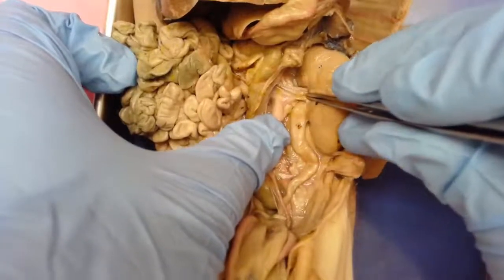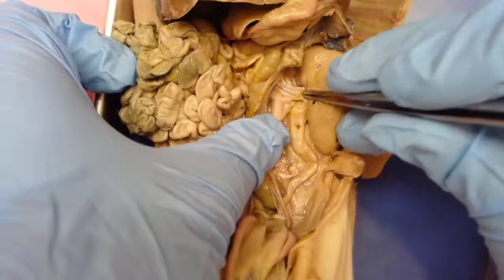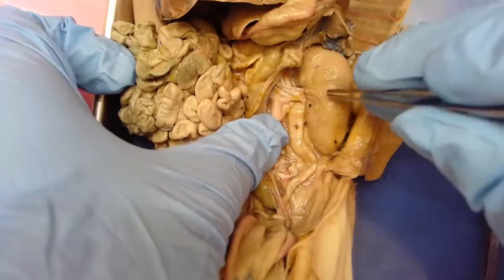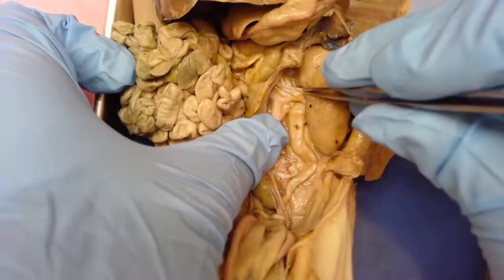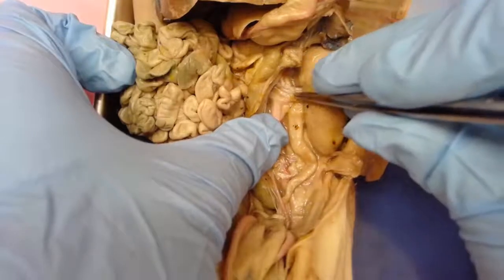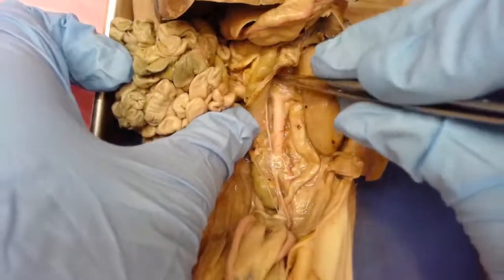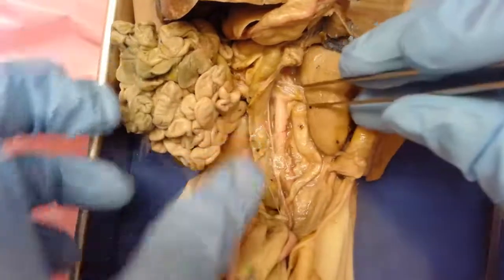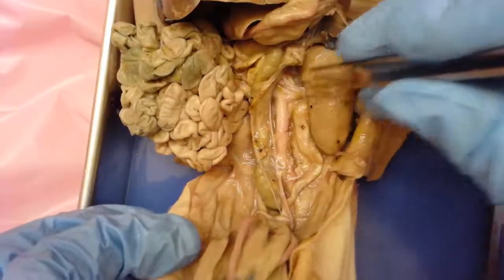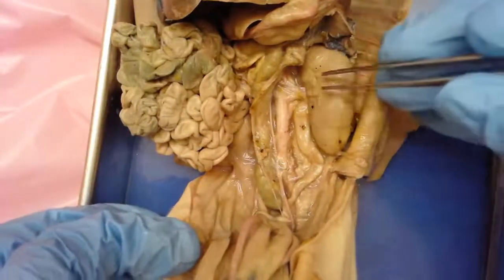In this bundle here you have a renal artery carrying blood that has waste. That waste gets filtered in the kidneys, and once it gets cleaned, it's put back into circulation through a renal vein that returns it to the vena cava and back to the heart. So those blood vessels are the renal artery and renal vein, going to and from the kidneys.